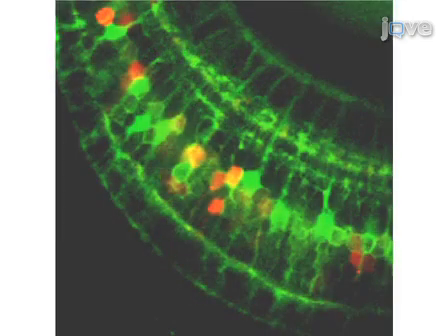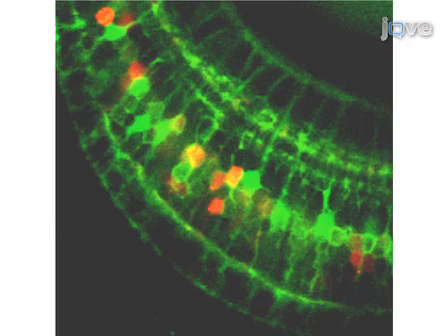The subtraction process then allows YFP-labeled bipolar cells to be removed from the GFP image, allowing GFP-labeled Muller glia to be cleanly represented and dimmer Muller cells to be detected. The overlap between dim Muller glia and M-cherry labeled bipolar cells, shown in red, can now be verified.